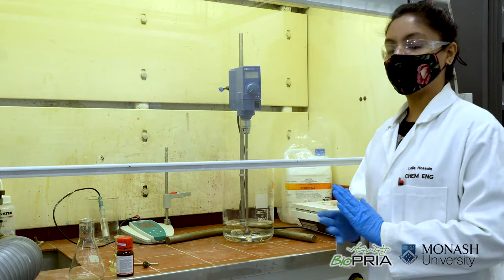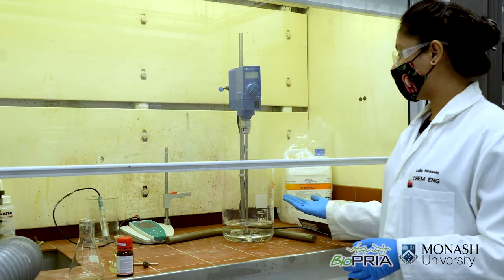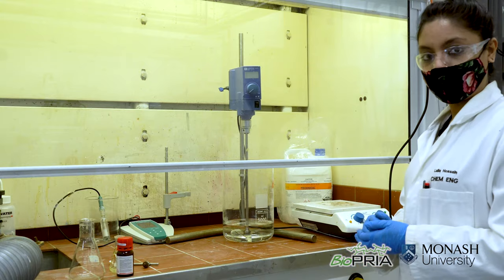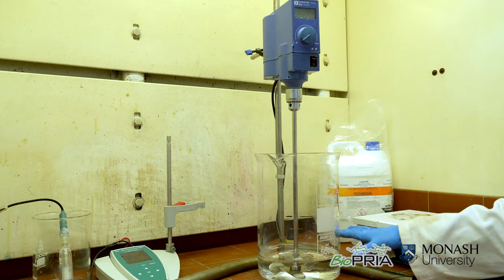Here I am going to show you how we do TEMPO mediated oxidation of cellulose fiber. So this is our setup for the oxidation reaction. Here we need 5 liter beaker with 800 ml water.